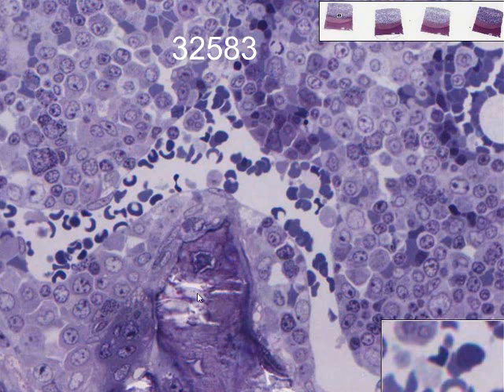You can see the spicule bone in through there, the osteoblast along the side. Here's actually an osteoclast, which eats up bone. And then this is a blood vessel. So these are red blood cells in the bone marrow, and these are white blood cells. Here you see a neutrophil. You can see the different lobes in through there as well.